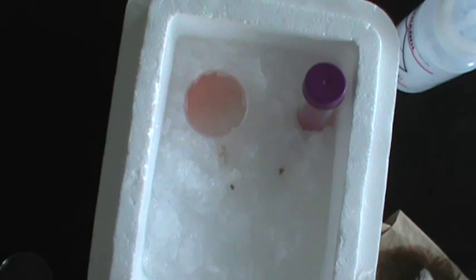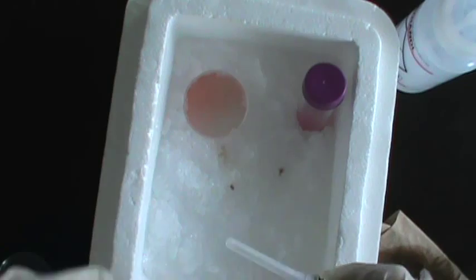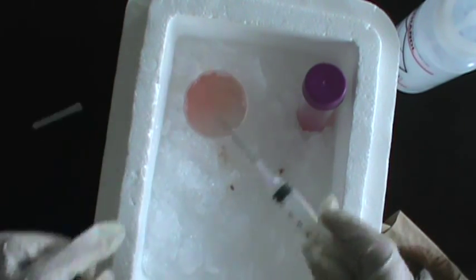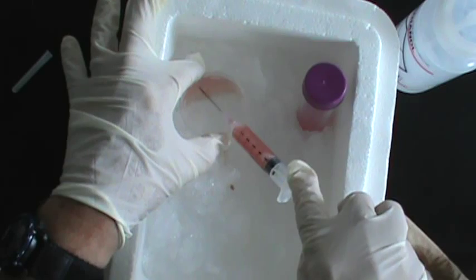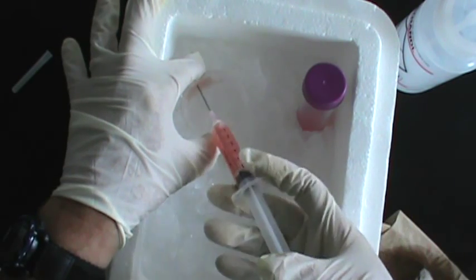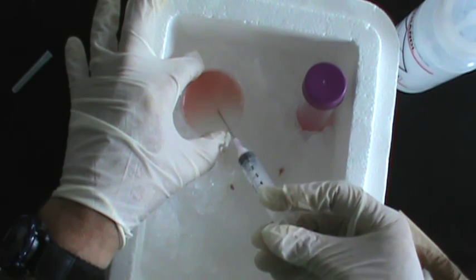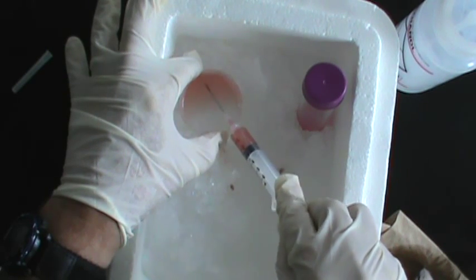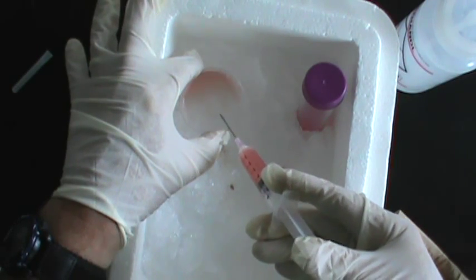and three different size needles. We're going to start with an 18 gauge needle, which is the largest bore, has the largest size hole in the needle. Very carefully remove the cap from that needle and draw this suspension of spleen cells up into the needle and force it back out. And do this three times. What this will do is this pulling the cells up through the needle will break apart the larger chunks of cells into smaller pieces.